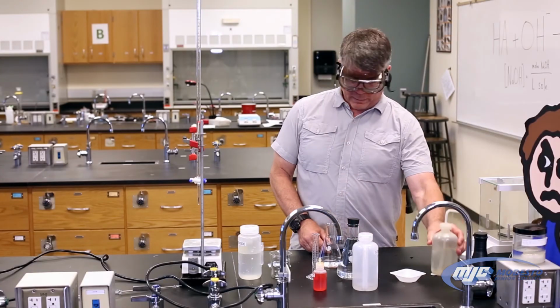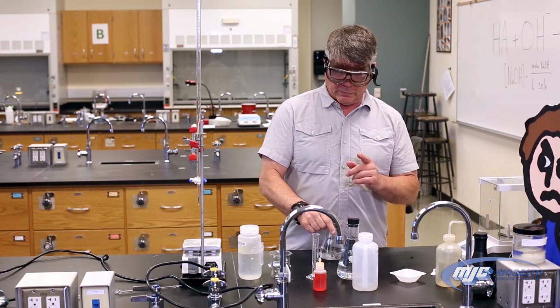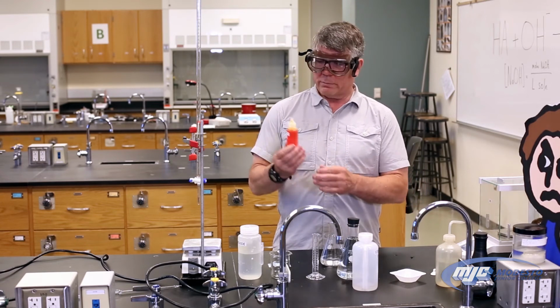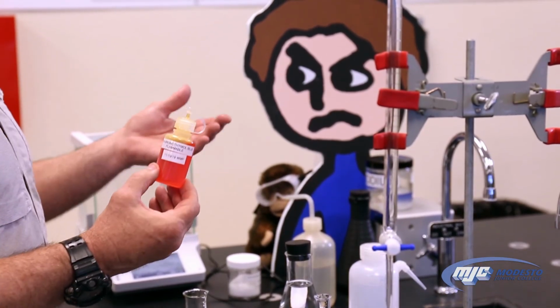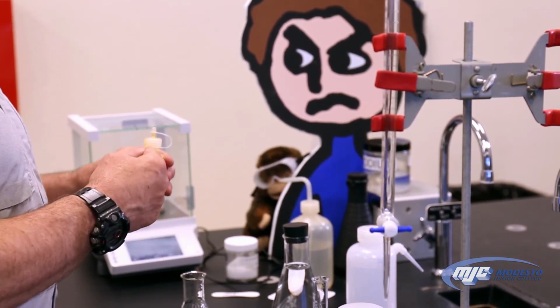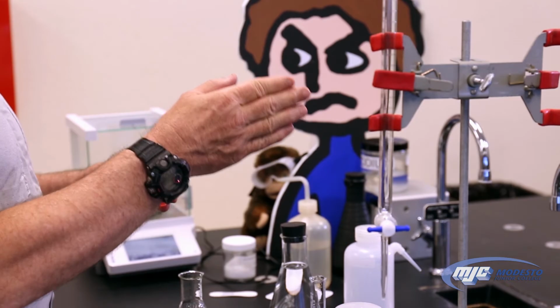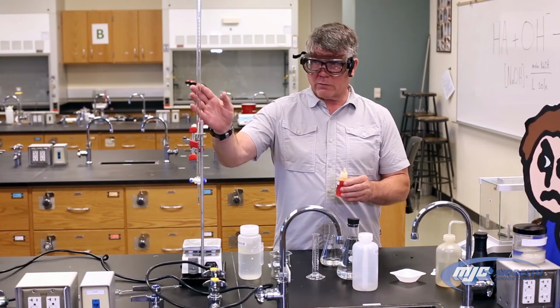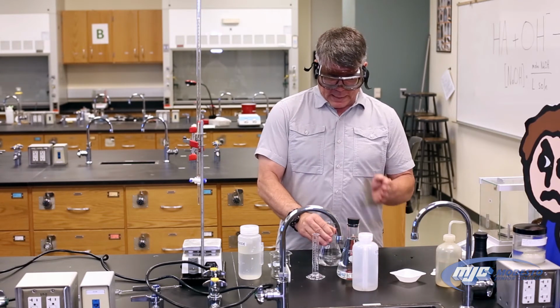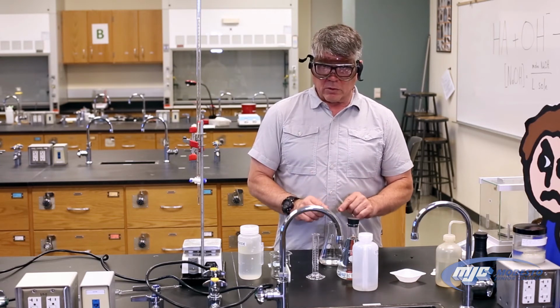The next thing we have to add to our KHP and water, really important, is our indicator. So we're going to use an indicator called bromothymol blue. That's what it looks like. It's red now. When it's in an acidic solution, it will be yellow. And when we reach our end point or equivalence point, it's going to go from yellow to green to blue. So our goal, we're going to add sodium hydroxide from this, which I'll show you guys in a minute. Our goal is to make just 1 drop of that sodium hydroxide solution make this change color.